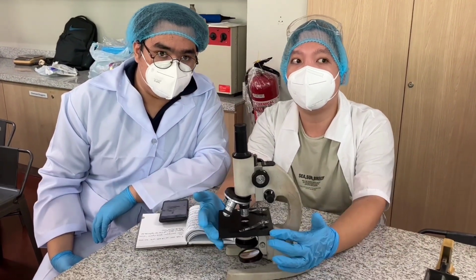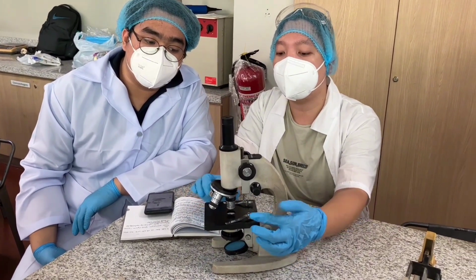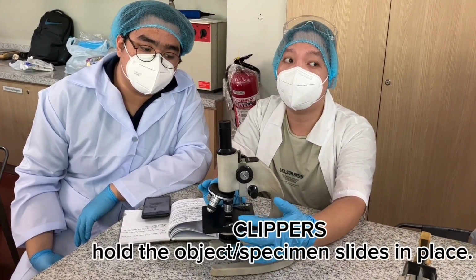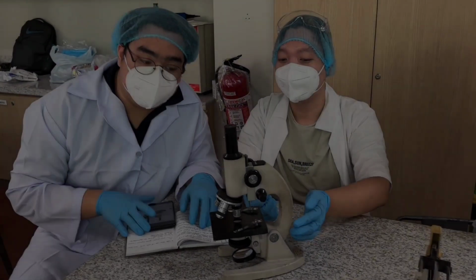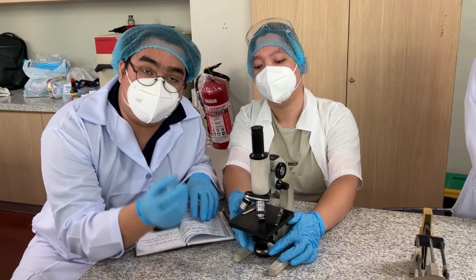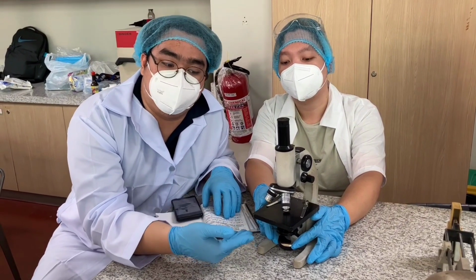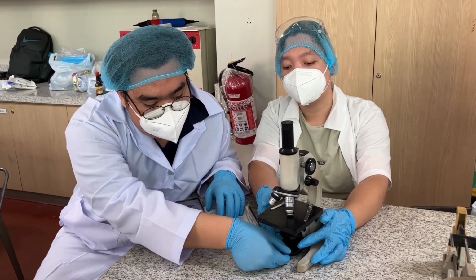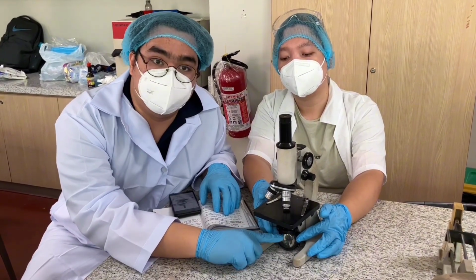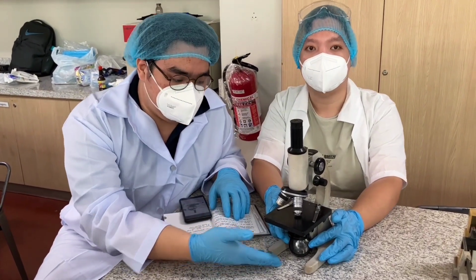Now moving on, we have our stage. The stage with clippers is where we put our specimen, and of course the clippers will be the ones to hold the glass slides and cover slips. Alright, the last part here is called the illuminator. This is the one that catches the source of light so that we can power the microscope and observe our specimen. As you can see, there is a little magnifying glass there in order to reflect the light back towards the lens so that we can finally observe our specimen.